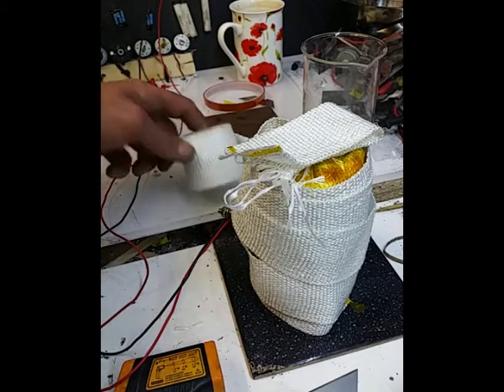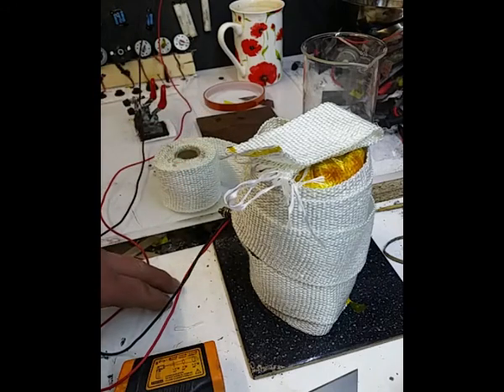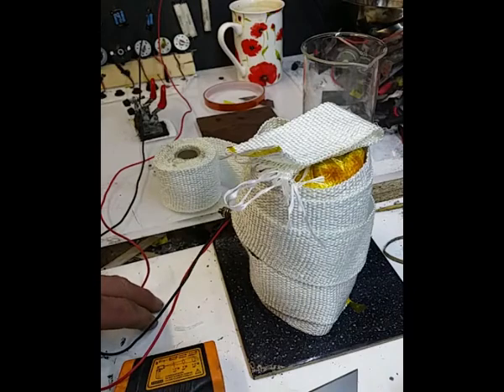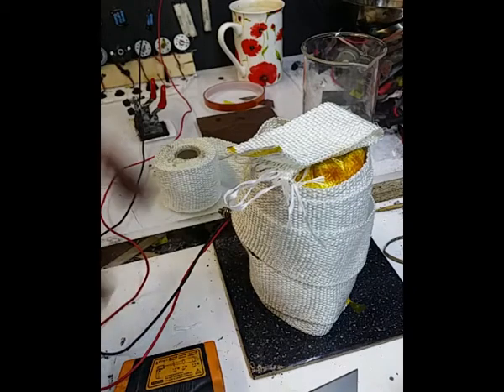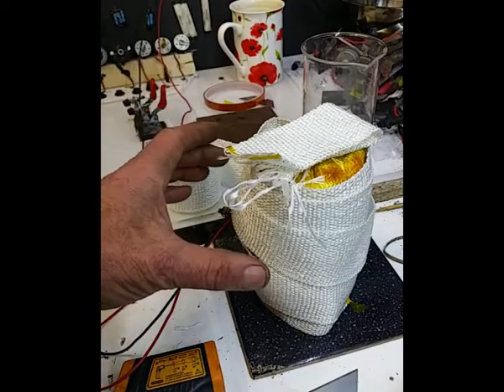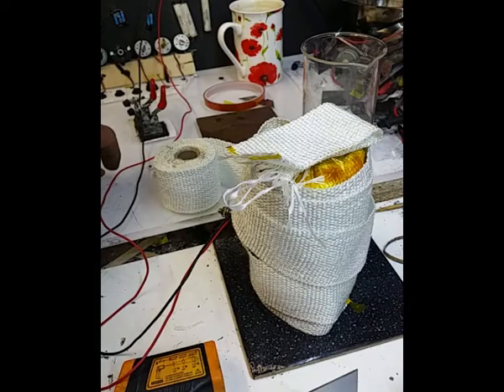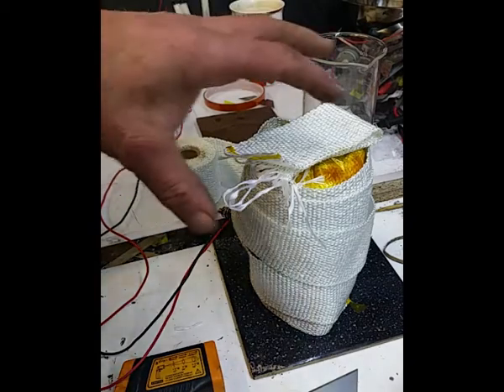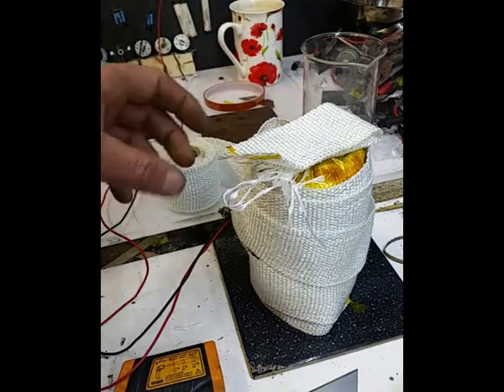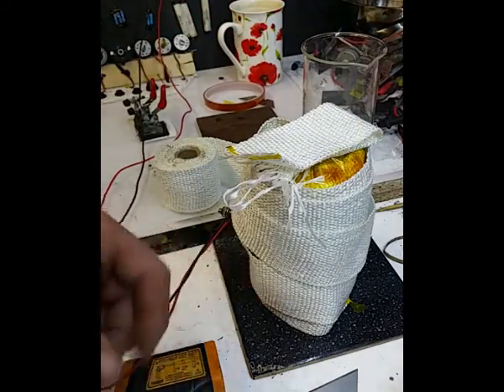I mean, this stuff's okay, but it's not really intended for this purpose. Well, not this particular purpose. It is intended to withhold heat, to keep heat in, but it's not the ideal scenario, and as I say, I would not do it this way. You need access to your bottom end cap for one.